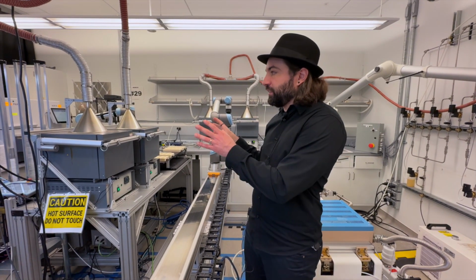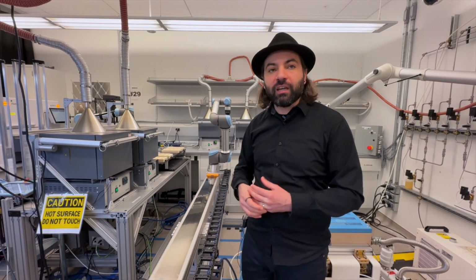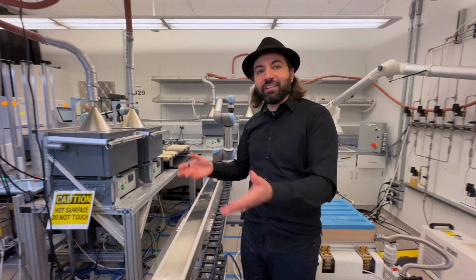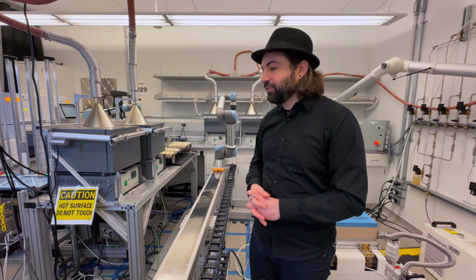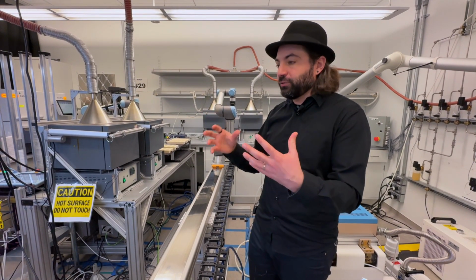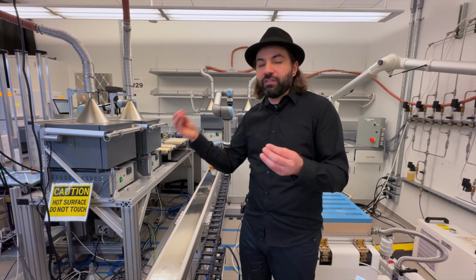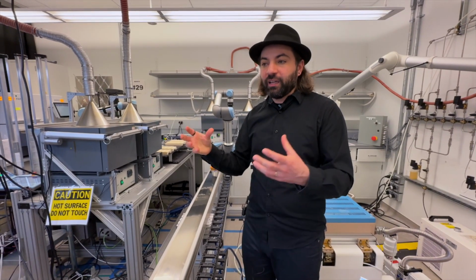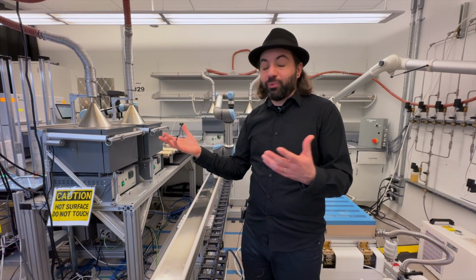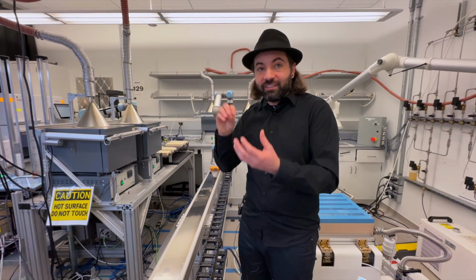So here you're using only the very basic automation ones, but for some applications you need the safety level ones. Fire extinguisher systems are also based on PLCs. So many of these industrial applications, when they touch the automation side, the PLC is what brings that. You can connect to this unit all the sensors and the actuators, and then you have this software that basically never breaks. It runs constantly, thousands of times per second, analyzing the sensors.